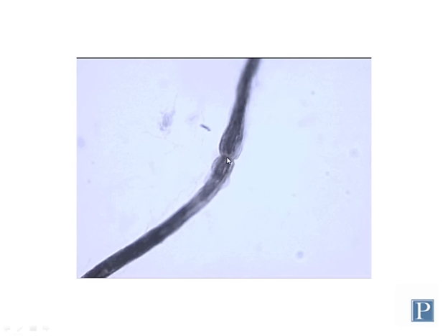It's thinned out here. This is an important structure called a node of Ranvier, and action potentials will jump from node to node in a type of neurotransmission that we'll talk about in lecture. So this is a very important structure to be able to identify in myelinated axons. Non-myelinated axons, of course, are not going to have nodes because they don't have the myelin sheath to begin with.